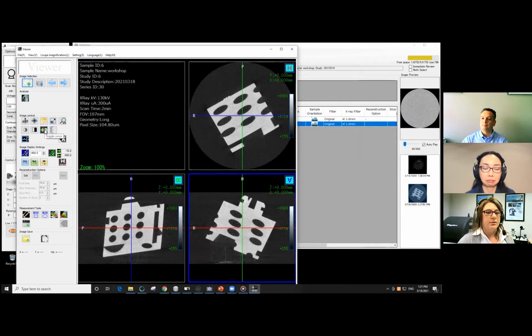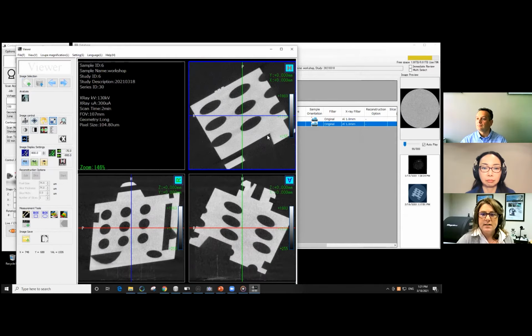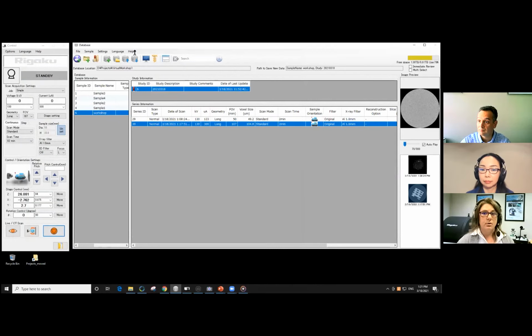So we could certainly adjust that. But we can zoom in and we can see that here, we see nice surfaces on all of them. And that's because you chose the correct answer. So tilted was correct for this. But let's look at what happens as a consequence of the position if you chose, for example, vertical or horizontal.